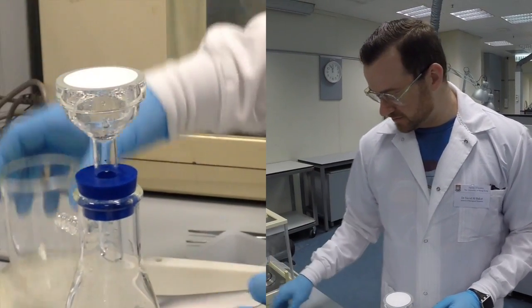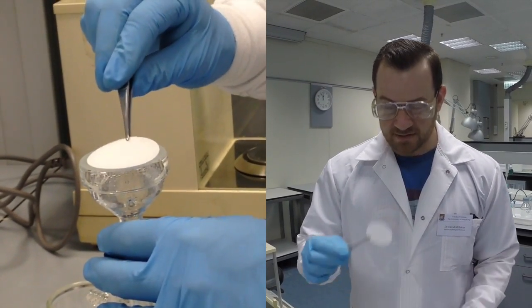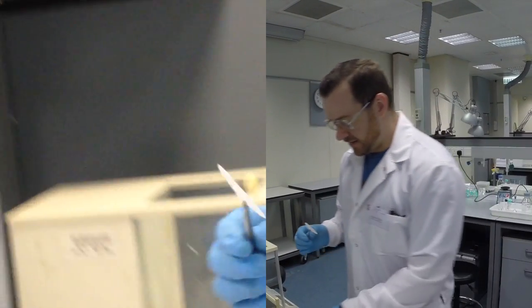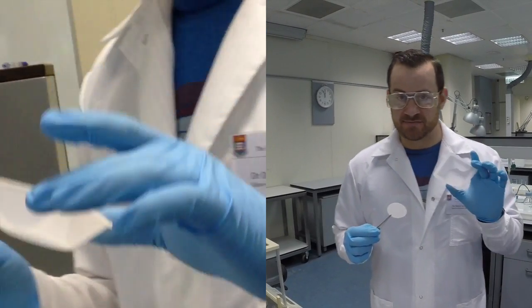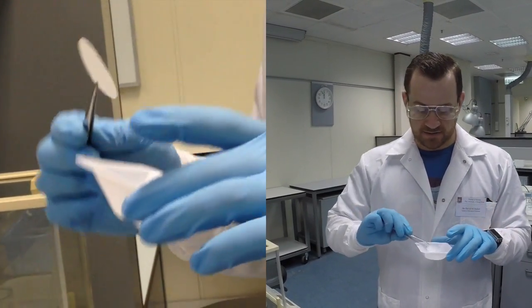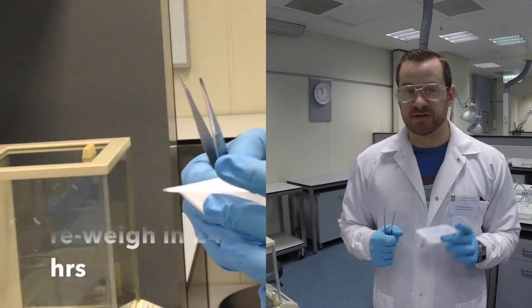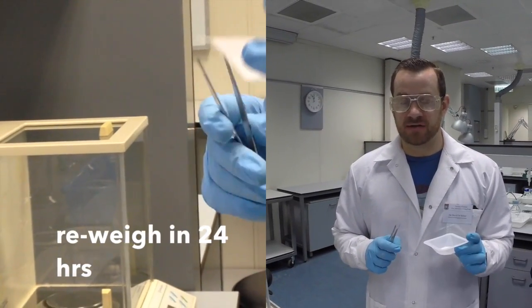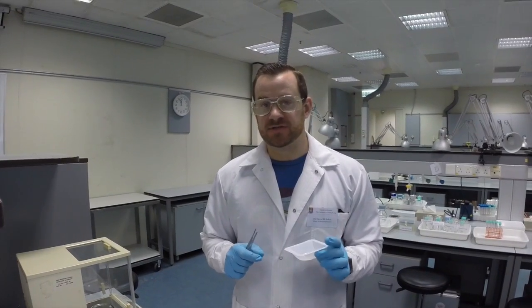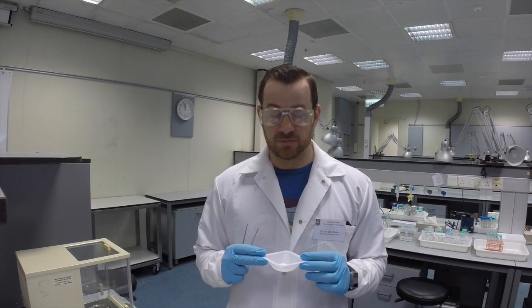So I remove the funnel. I can use forceps to remove my filter very carefully. And then I'm going to place it into a labeled plastic tray that has my group number indicated on it. And I'll give it to my demonstrator for drying. Now, someone from your group must return in 24 hours to weigh the final mass of your glass fiber filter, and then use the difference between that and the initial value to calculate the total suspended solids within a volume of liquid.